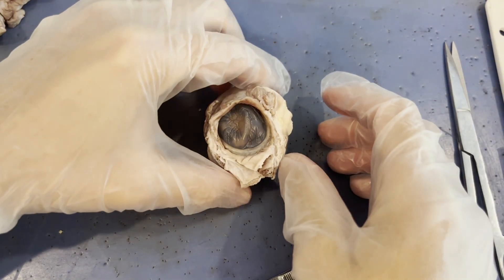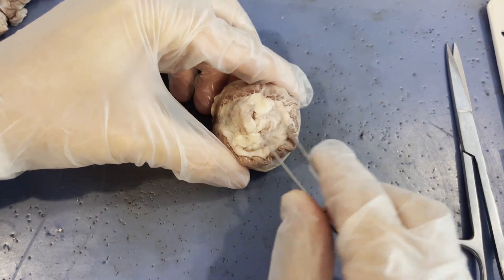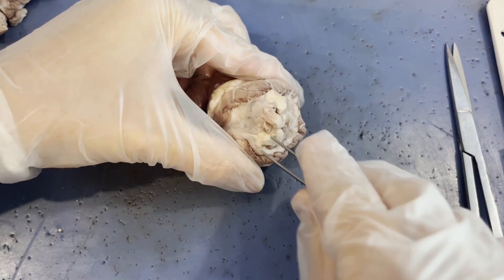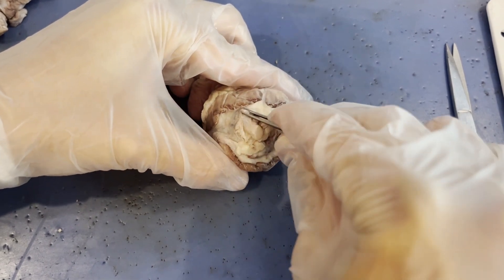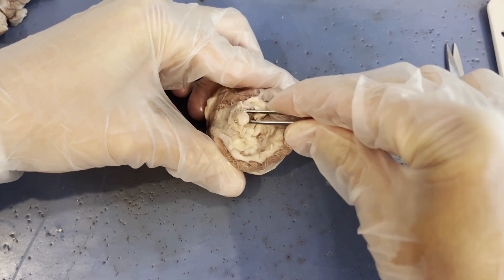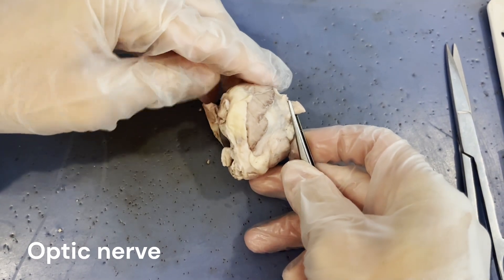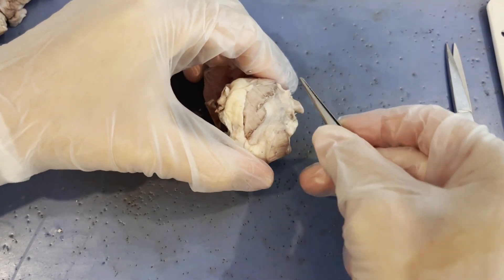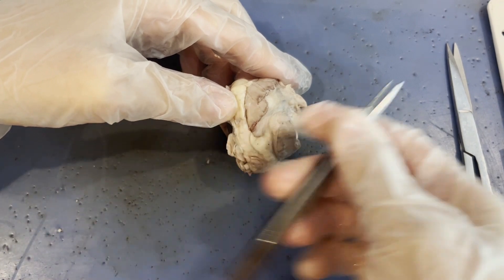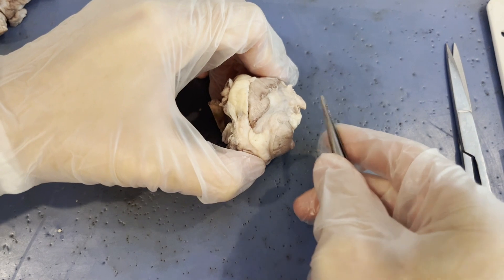If I flip the eye over, on the back of the eye there's a lot of adipose tissue and more of those extraocular muscles. But I see this interesting structure right here — it looks like a totally different substance than the adipose tissue, because it is. It's not fat tissue at all; it's a bundle of nerve fibers. This is the optic nerve. When the cow had its eyeball inside its head, the optic nerve connected the eyeball to the brain. Any light information that comes into the eye travels through the eye, and at the optic nerve, that light information is passed to the brain.